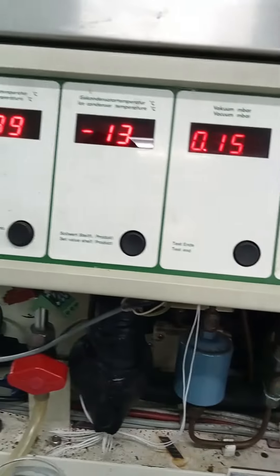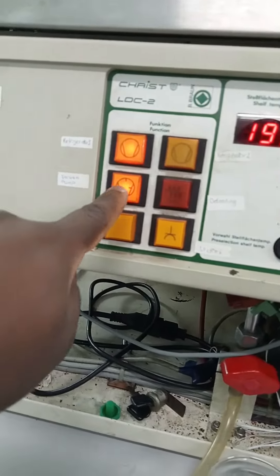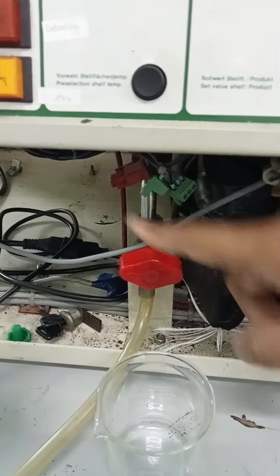Put my sample, put this one, make sure it's on, then on, close — okay — on the refrigerator. Make sure this one is horizontal like this.